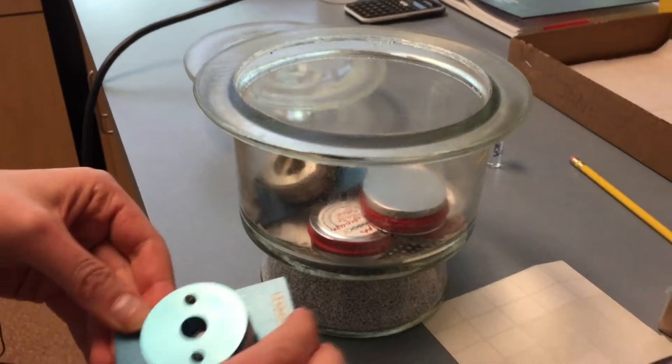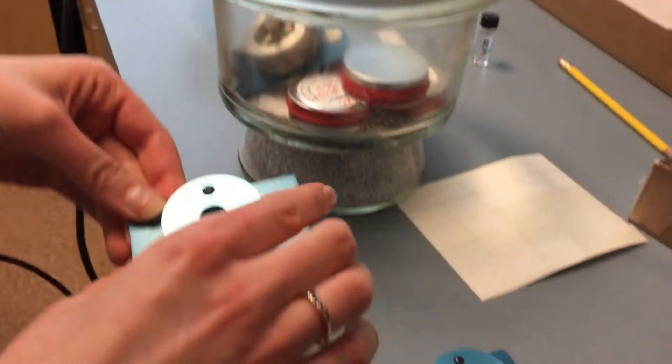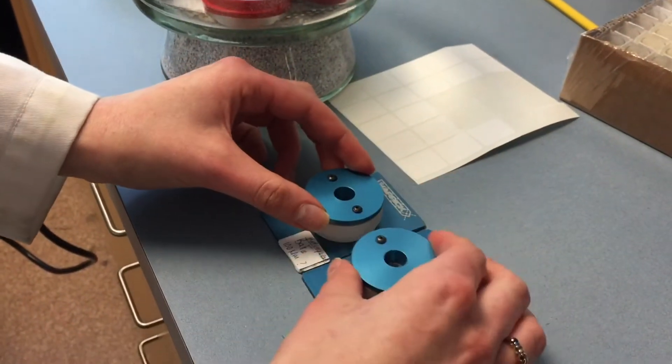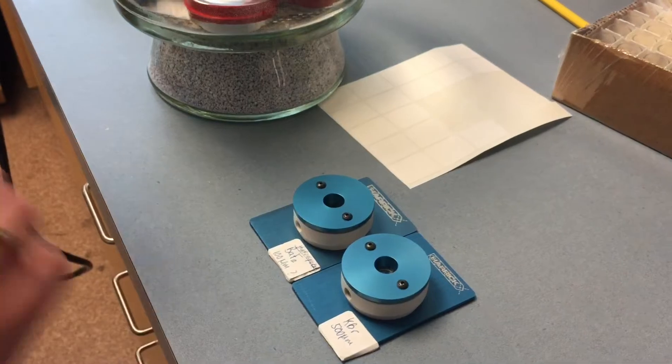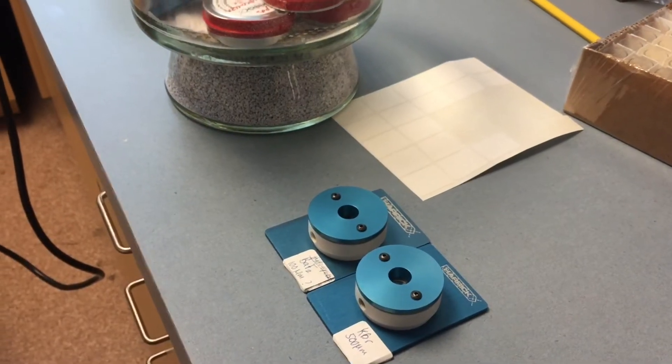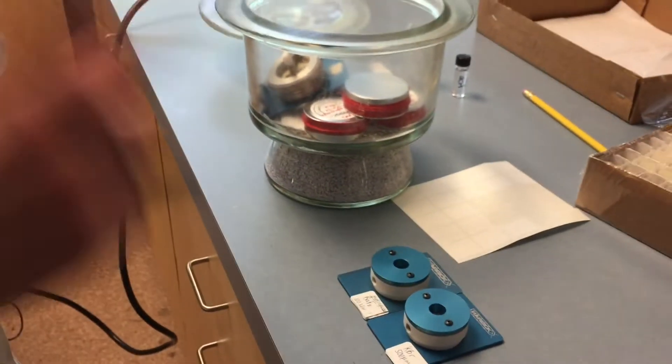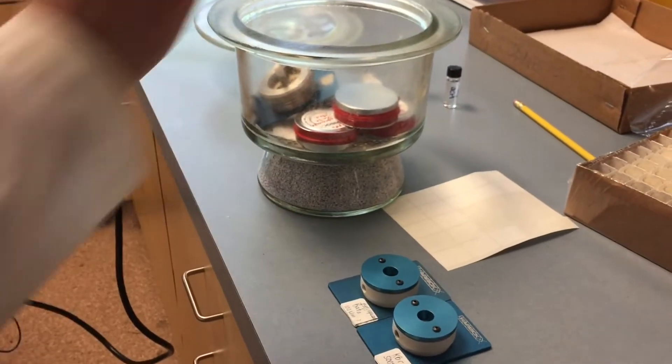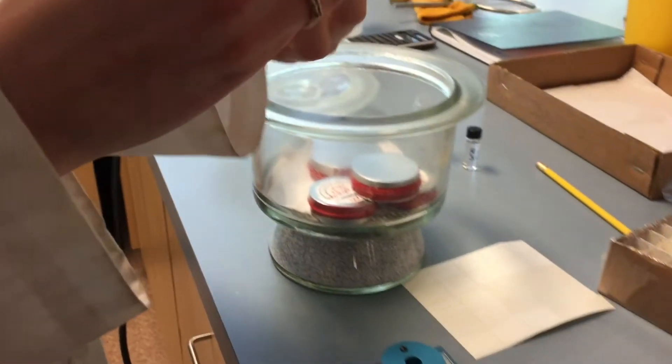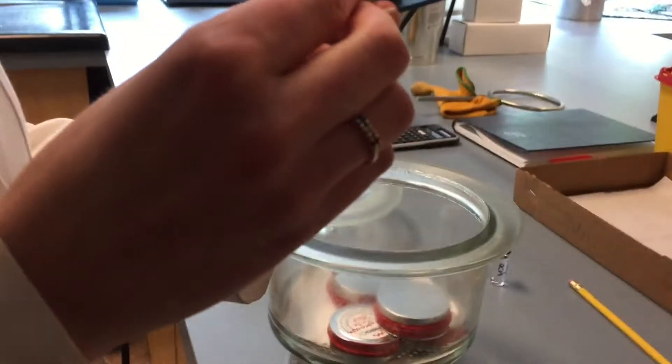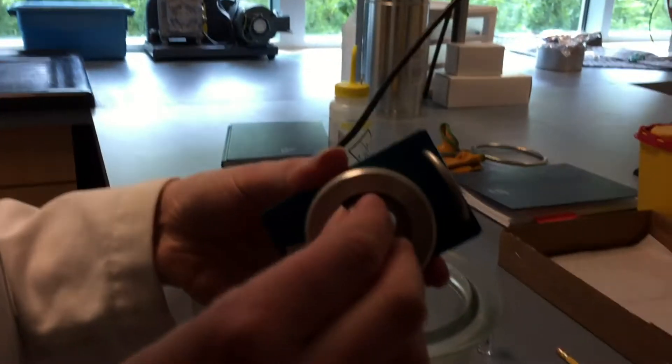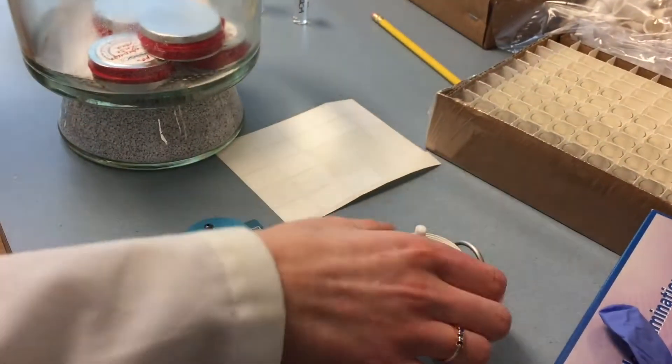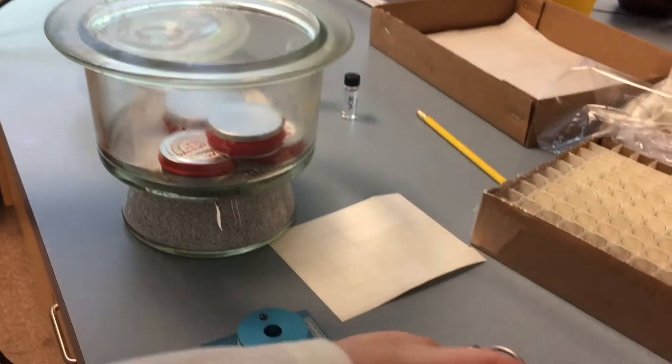When you are choosing a cell window material, you should look at your solvent that you're planning on using and its solvation properties and which material would be better. I also have this cell, which I think is KBR. I just found it in the lab. It has a crack in it and probably leaks.